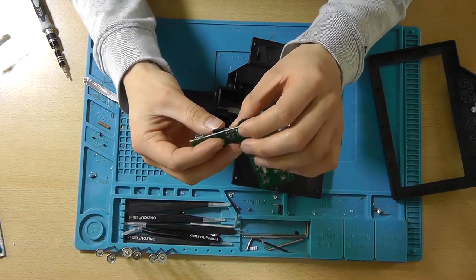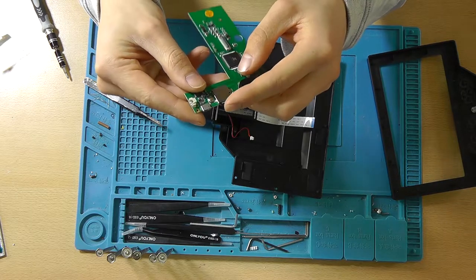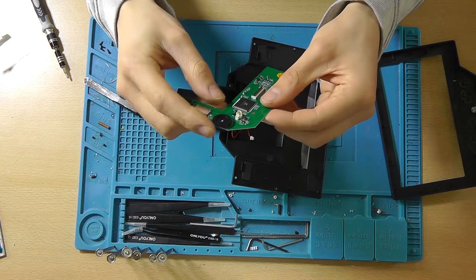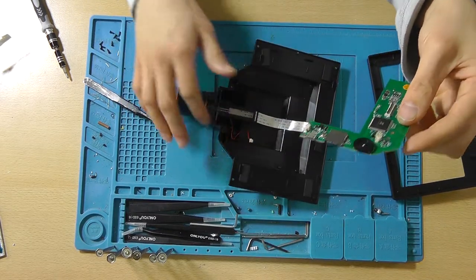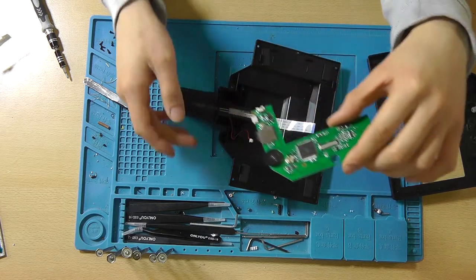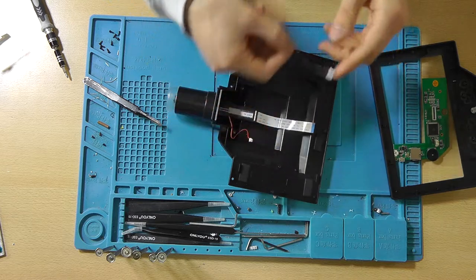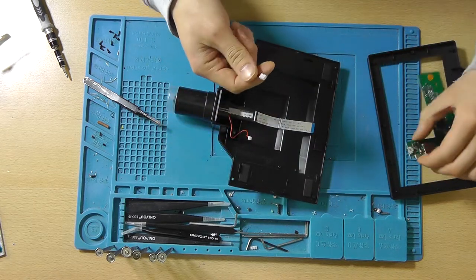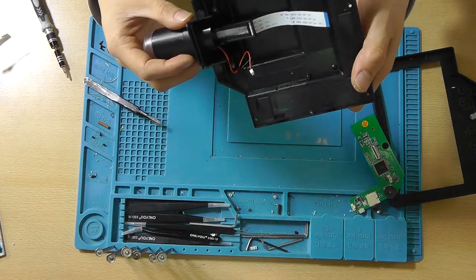So you can also see the SD card module that has actually been soldered quite nicely. So I guess I'm just going to sand down the edges of the case a little bit to make the SD card fit better. Now, I do have one of these connectors, but by the looks of it, it's a little bit too big. So first, let's actually try to fix the SD card slot.